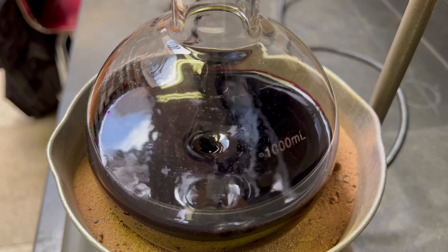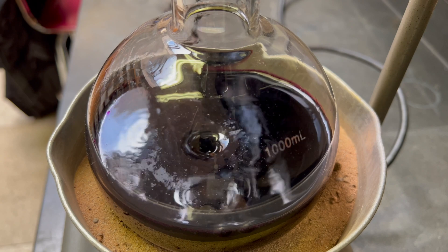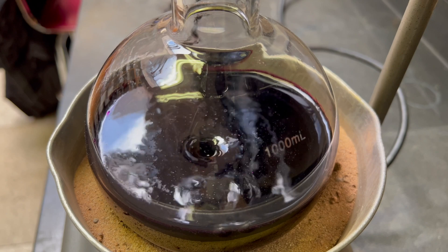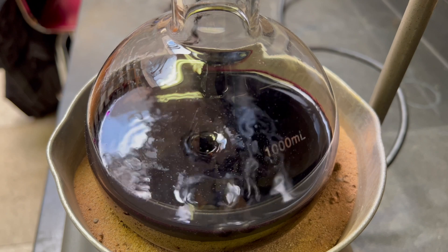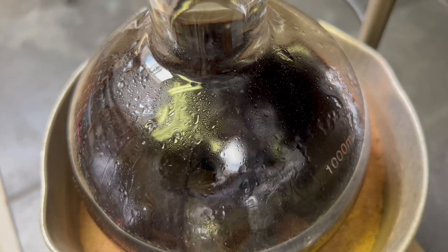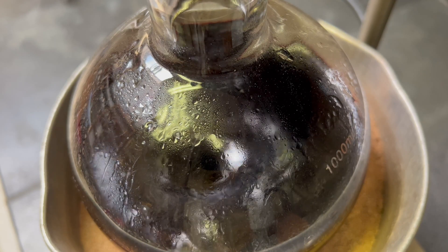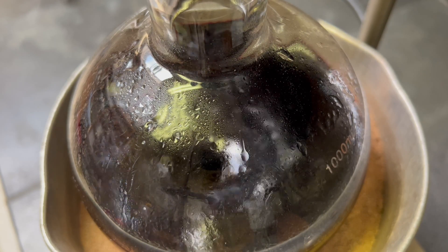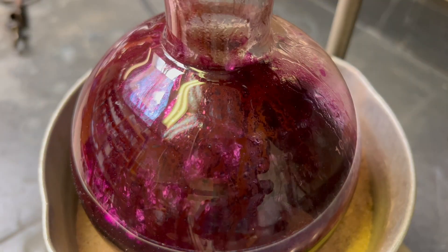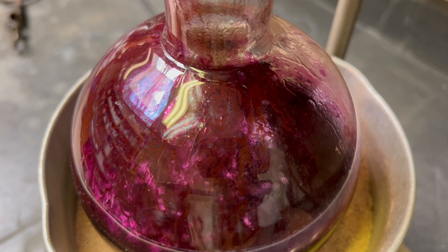In this reaction, the potassium permanganate oxidizes toluene to benzoic acid. This benzoic acid is then deprotonated in the hydroxide solution to form potassium benzoate. This reaction reduces the potassium permanganate into manganese dioxide. After a few hours of reflux, the solution has changed color from the bright gorgeous purple of potassium permanganate into a dull brown. The color change is due to the byproduct of manganese dioxide.